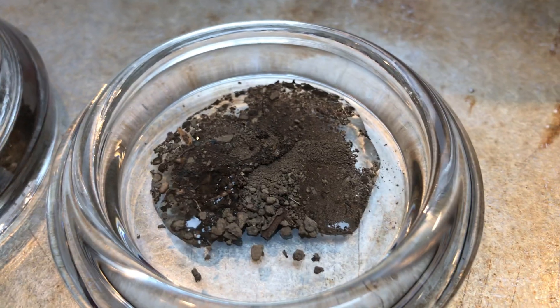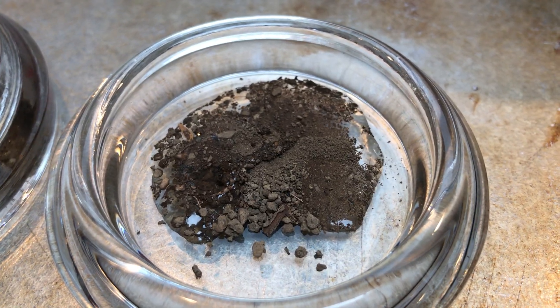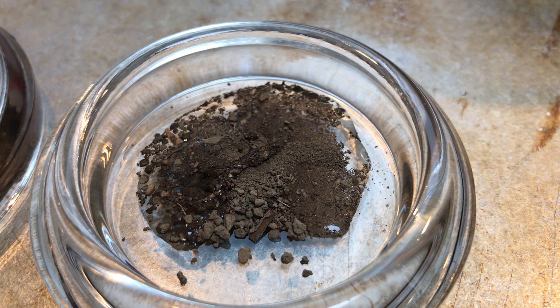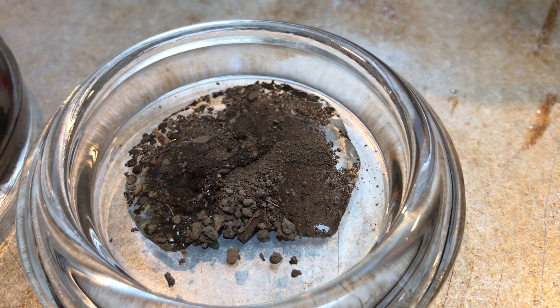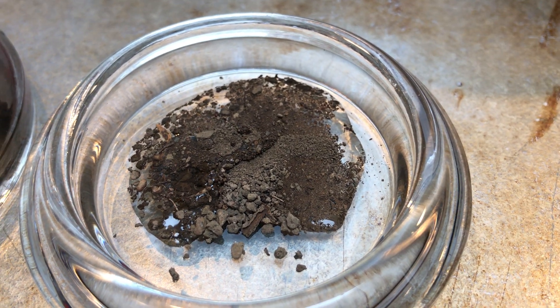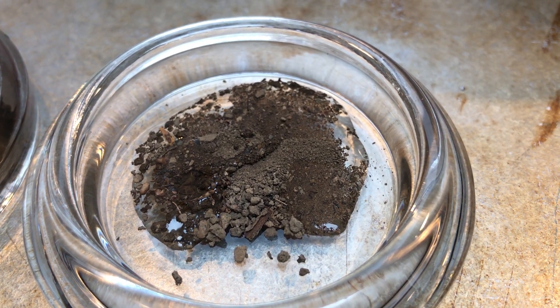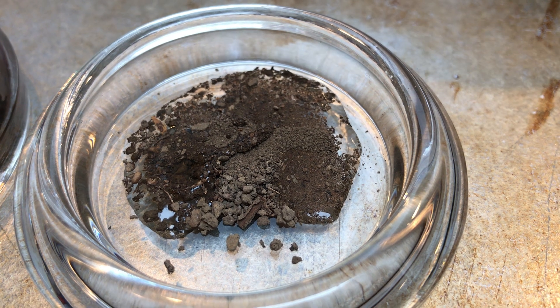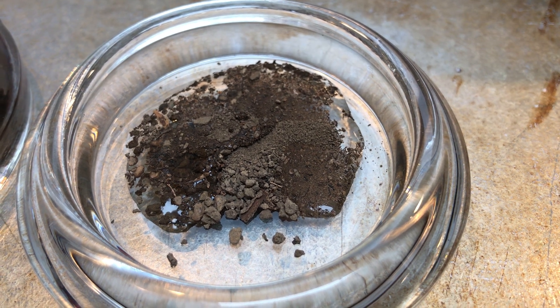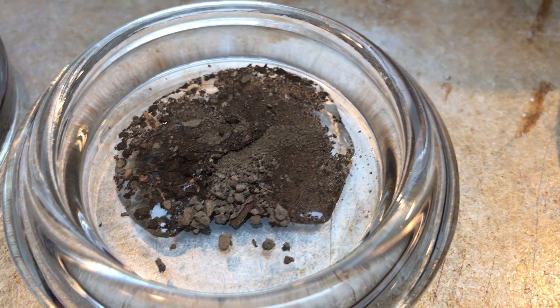And if we look closely, do you see any fizzing there, Bridget? No. I don't see any either. So we can say for certain that our suspect sample is negative for calcite.